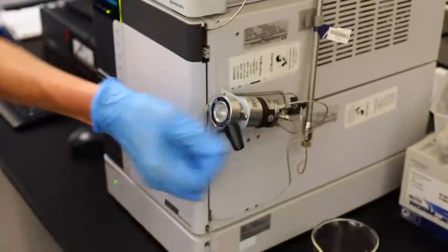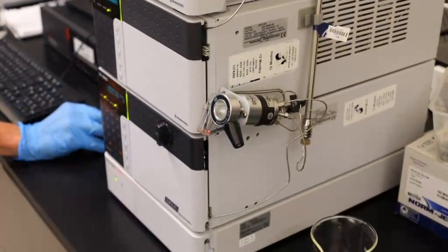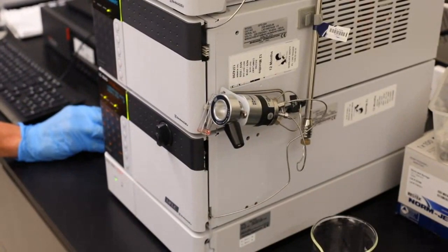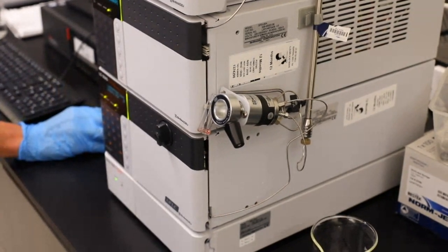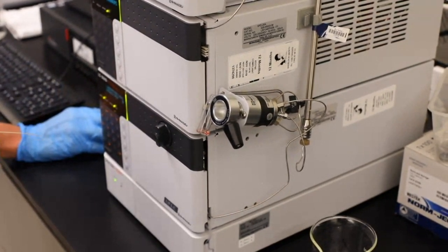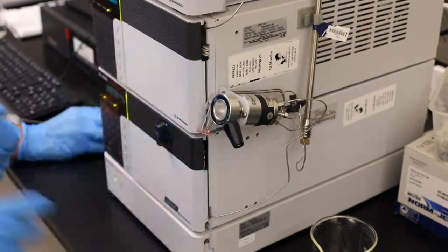Already injected. Awesome. That's already injected. Yeah, it's already in there. What's wrong? Having a hissy fit, is it? I love HPLCs when they work. It worked 2 minutes ago. If it didn't work, it's okay. We got one we prepared earlier where we ran. I'm just going to stop analysis and start again. That's okay. We'll just still show them where it goes in.